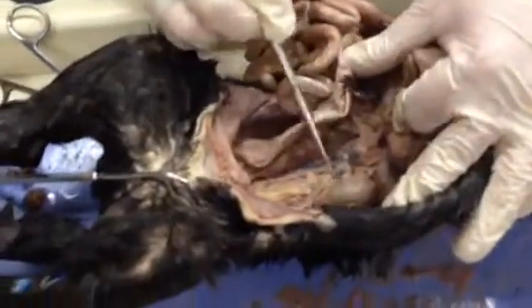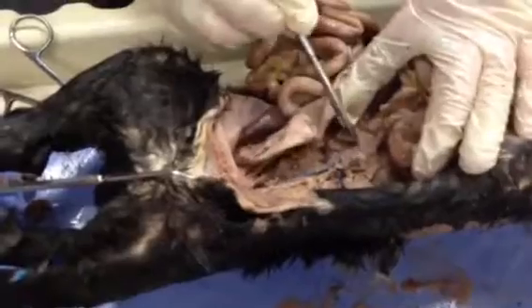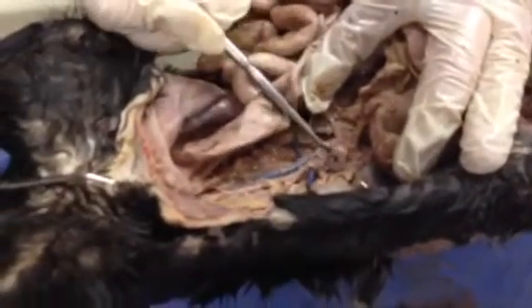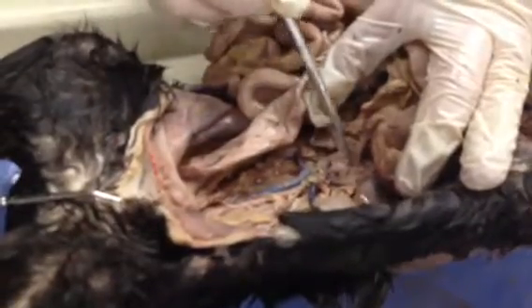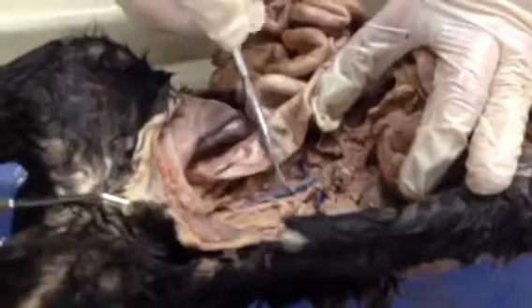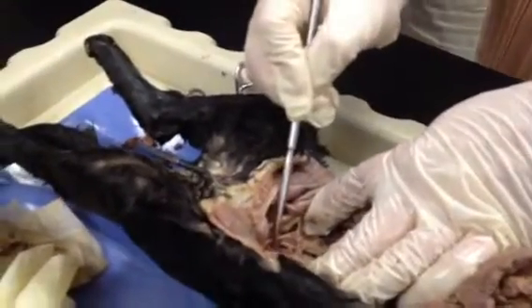We have a kidney here with the renal vein and renal artery next to it, and really, really tiny next to that, like a little tiny pea, you can see a lateral branch. That is your adrenal gland, also called the suprarenal gland. This here would be your inferior vena cava, and we can see how our aorta is going to bifurcate into the common iliac arteries down below.